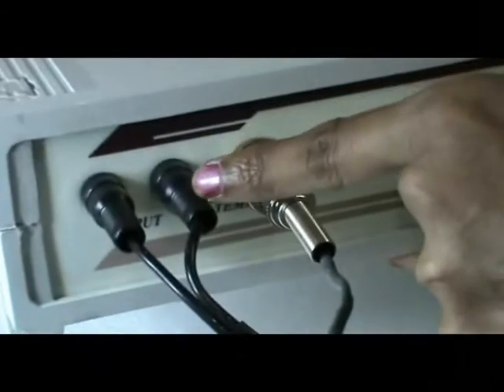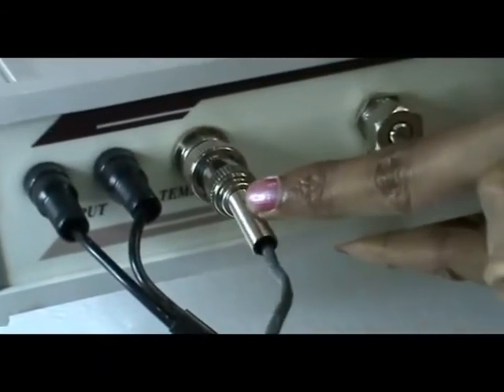Connect the conductivity cell and temperature probe at the back side. This connector is for the conductivity cell and this one is for the temperature probe connection.